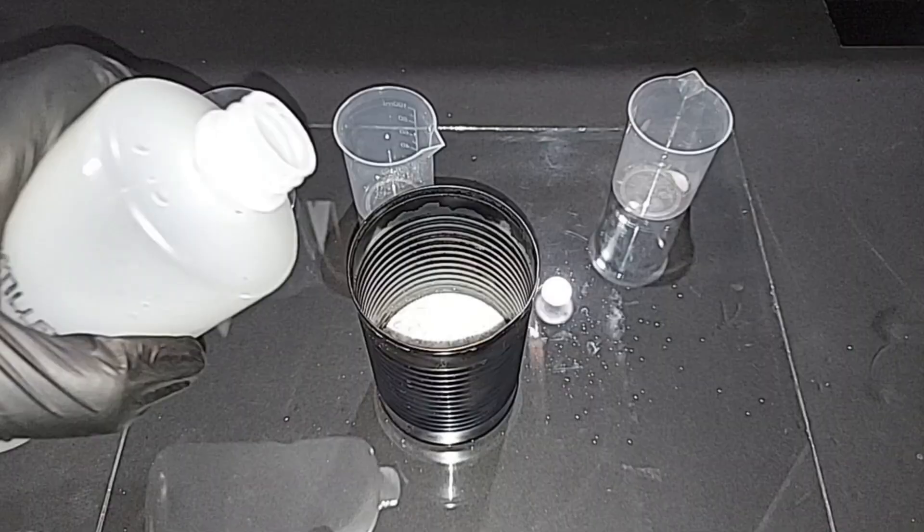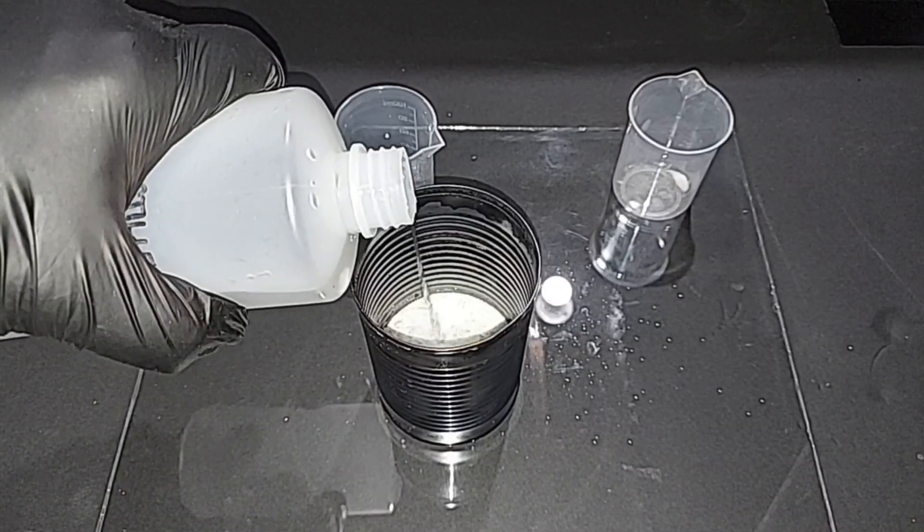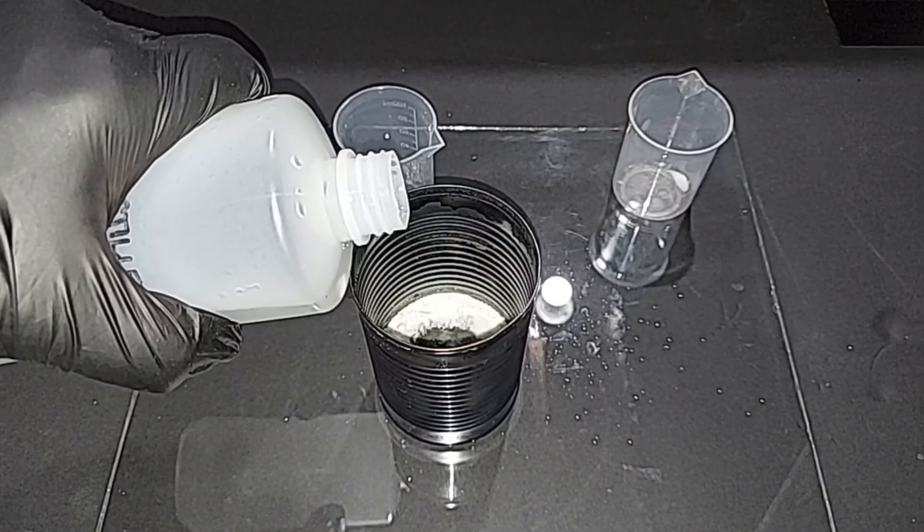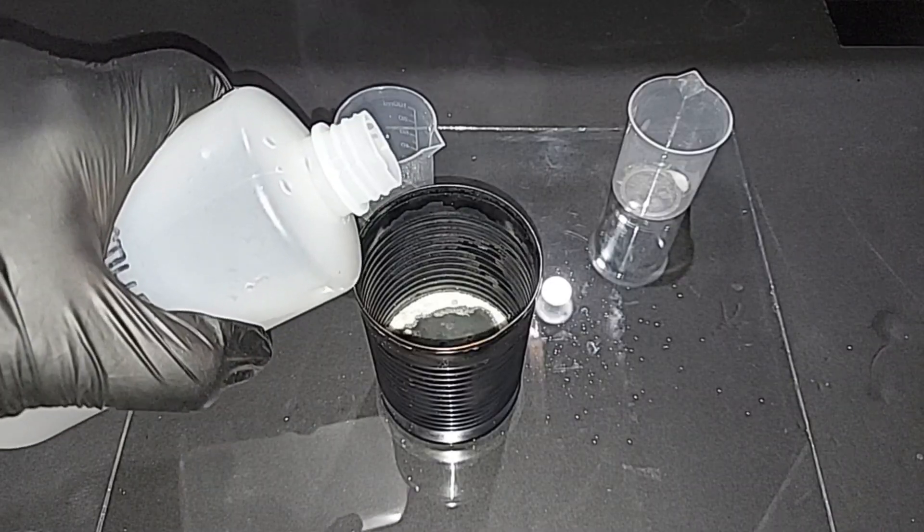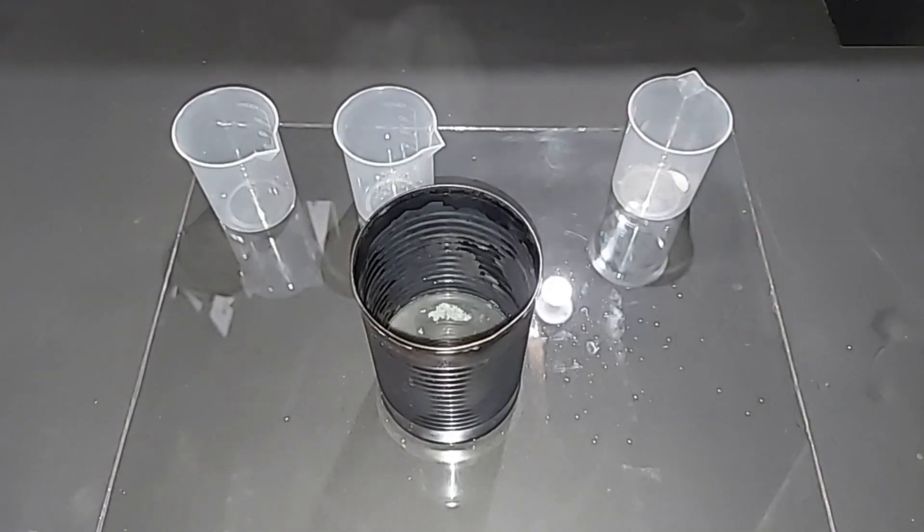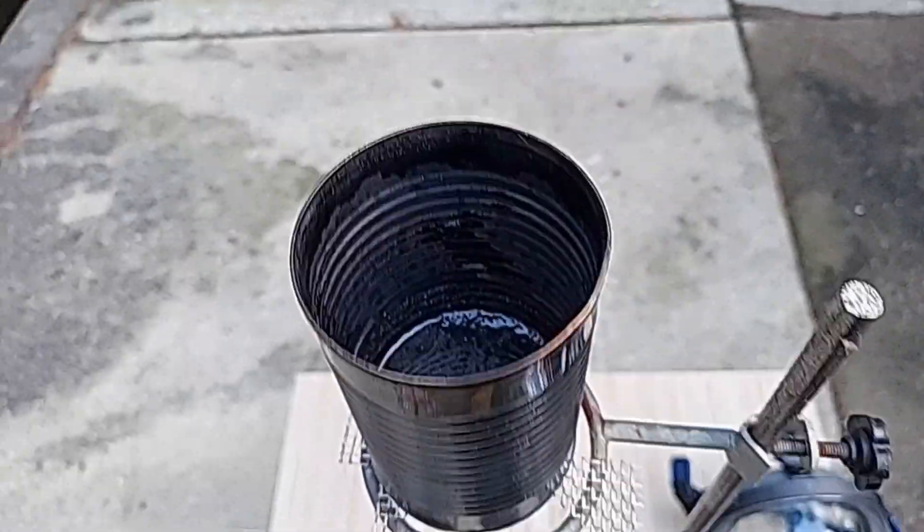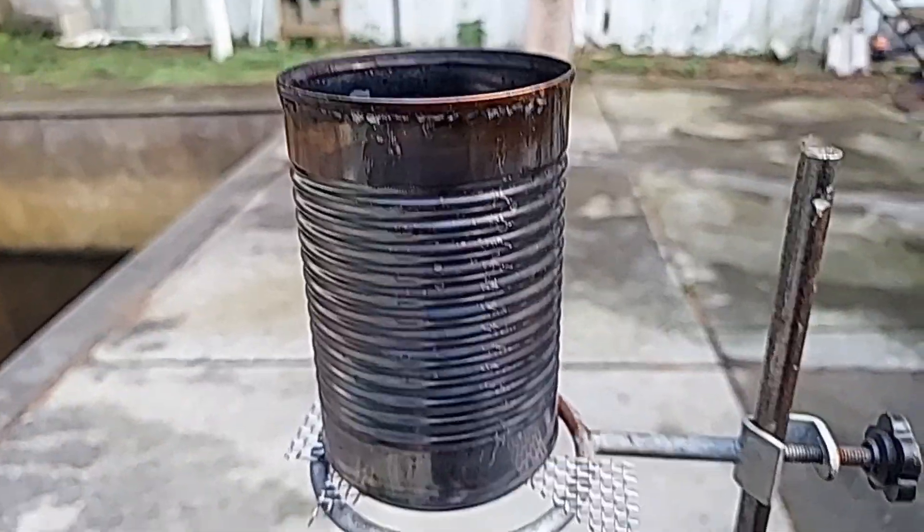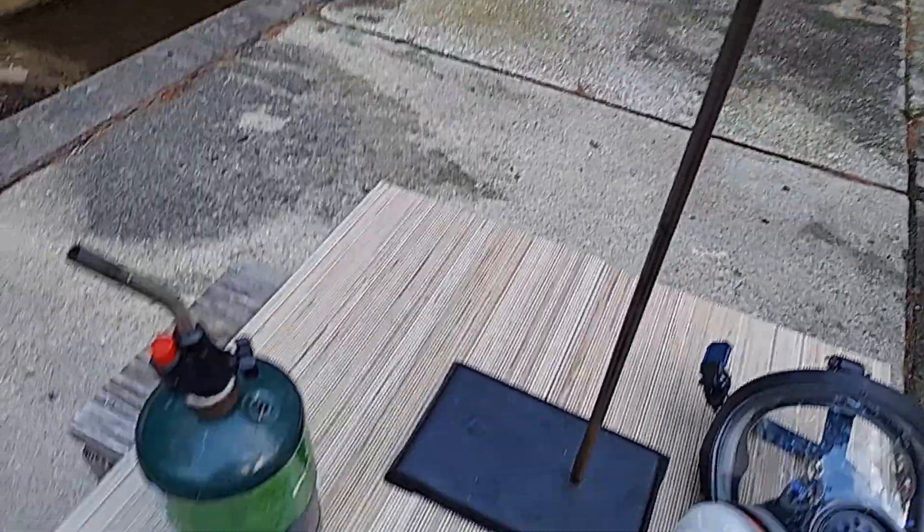I'm going to add just a small amount of distilled water. You want to use as little as possible, just enough to get things that will dissolve, dissolved. You can already see the reaction starting. Next, we're going to heat it a lot. There's the mix right there with the water still, of course. It's cooled down a little bit in the five minutes it took to get out here.